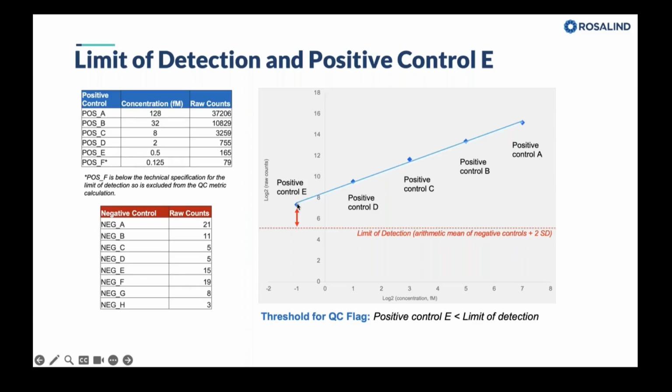If this positive control E drops below or underneath this dotted line, then we get a QC flag that's thrown, and that's what's written down here. If this positive control E drops below the limit of detection.